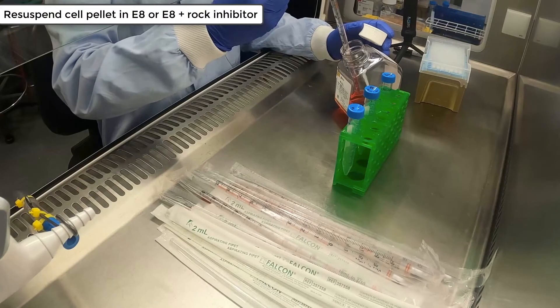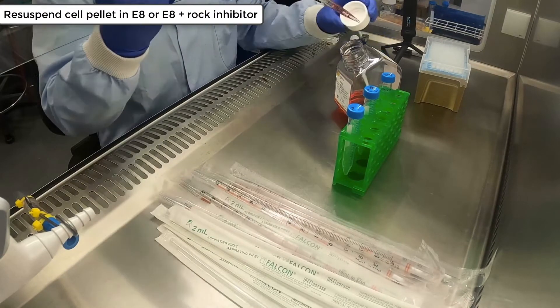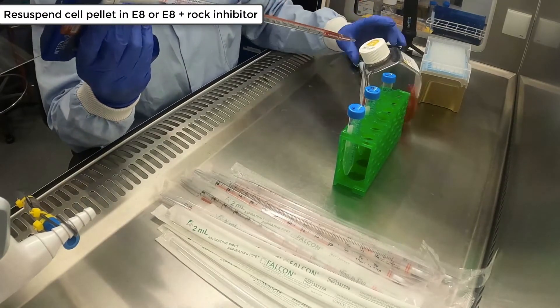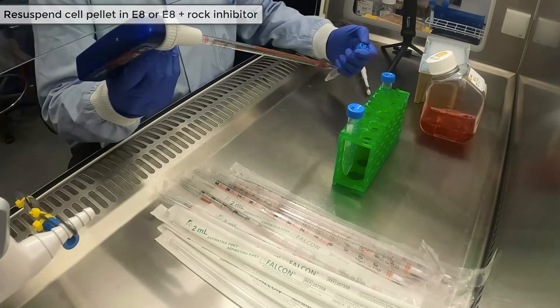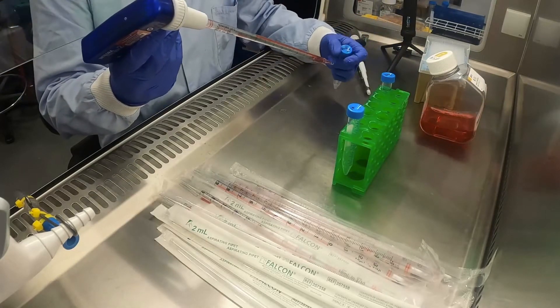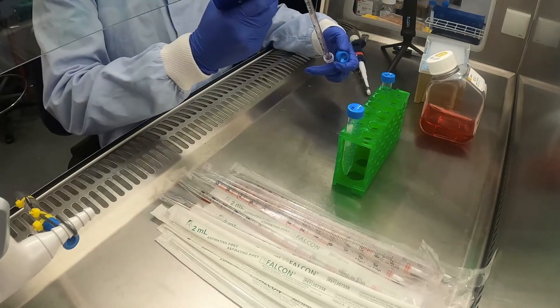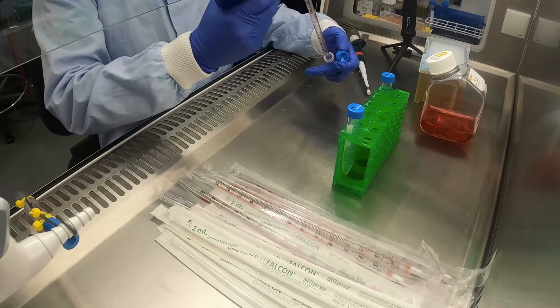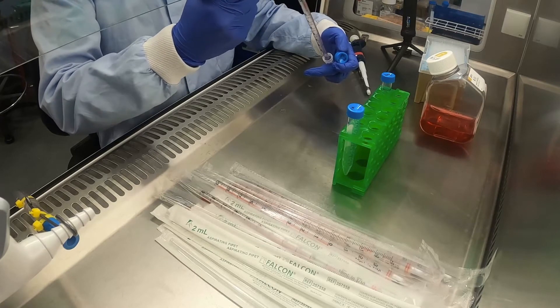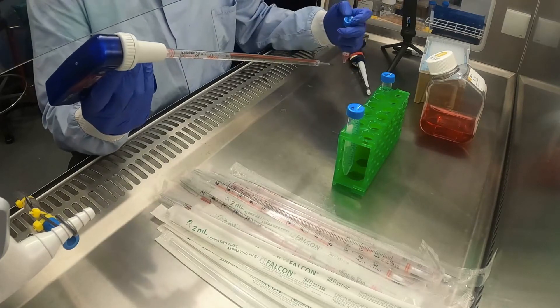Then resuspend one of the falcon tubes in 2ml of E8 and resuspend the other in 2ml of E8 plus rock inhibitor. Make sure you do the resuspension thoroughly, as any clumps of cells will make the cell count inaccurate.